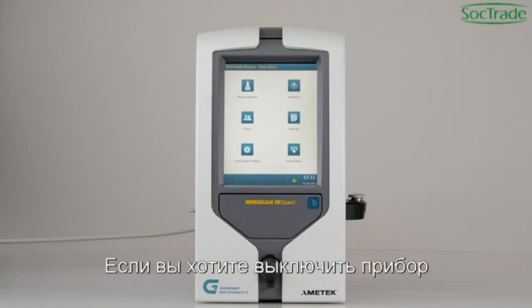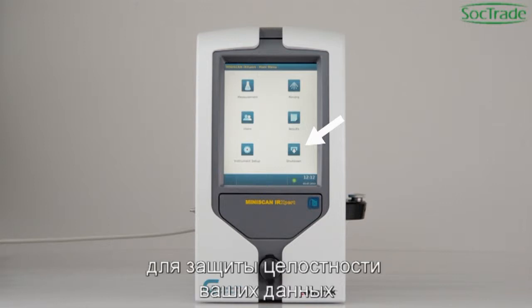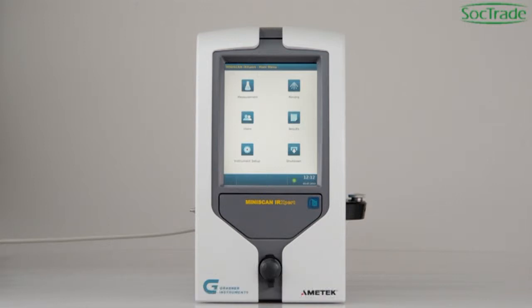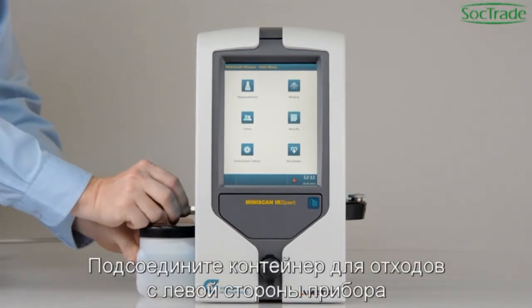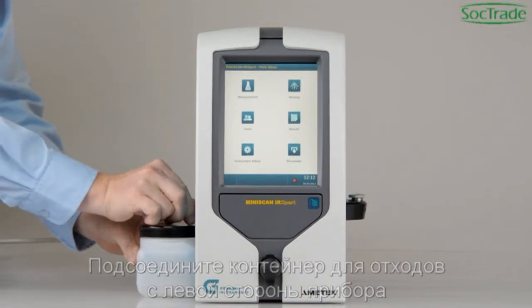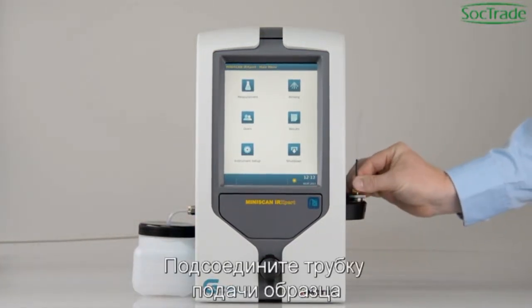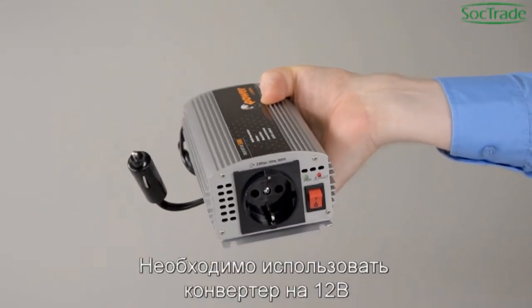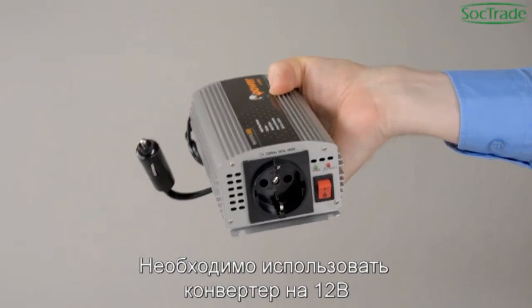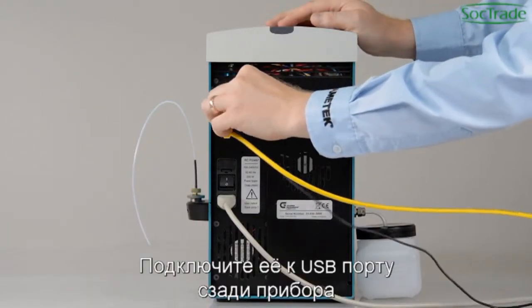If you turn off the analyzer, please use the shutdown button to protect the integrity of your data. Connect the waste container on the left side of the instrument. Connect the sample tube. If you connect to a vehicle battery, a 12-volt power converter is required. If you want to use a keyboard, attach it to a USB port on the rear side of the instrument.